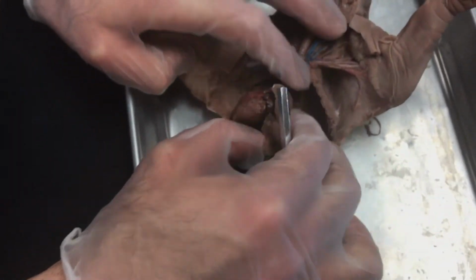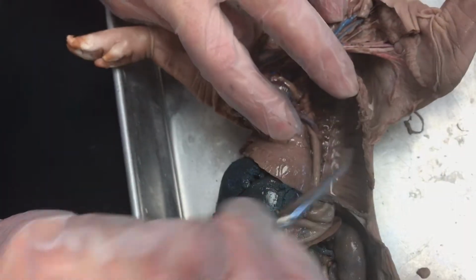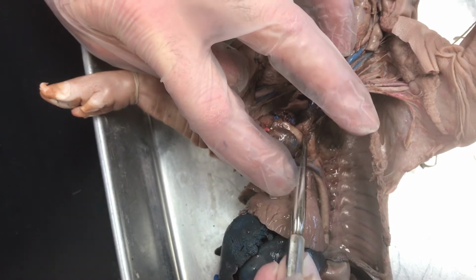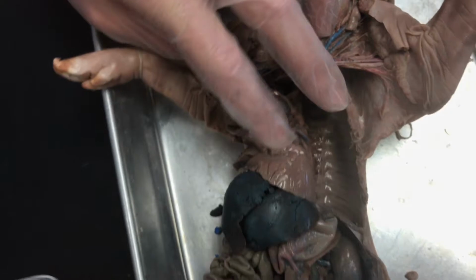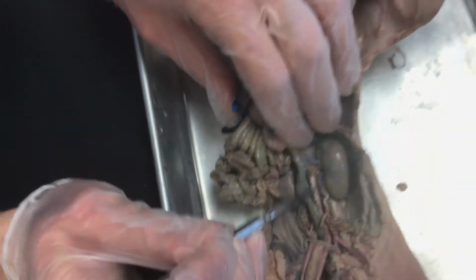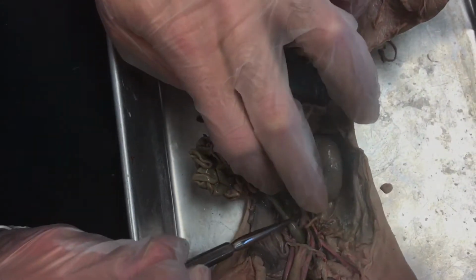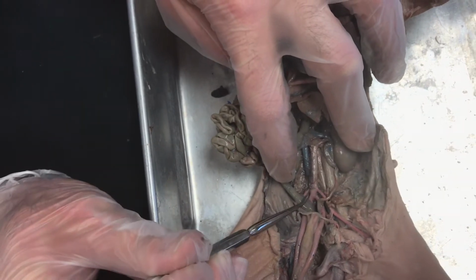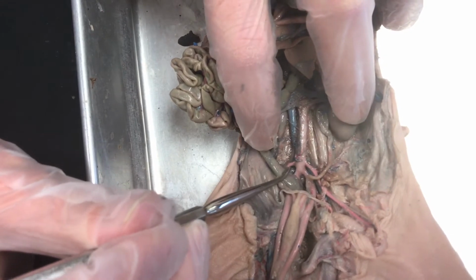Blood vessels. I like to start here with the heart, and if I pull all this out of the way, you can see this large blood vessel coming down. That arch is the aorta. So the aorta arches out, it comes down, and then it follows all the way down here to the lower end of the pig. And then you can see it branches. So these external branches are called the iliac arteries, which are in the hip region.